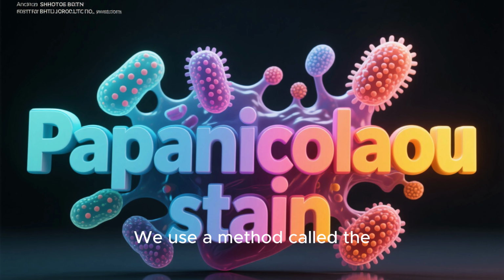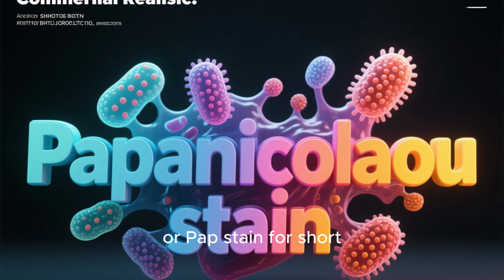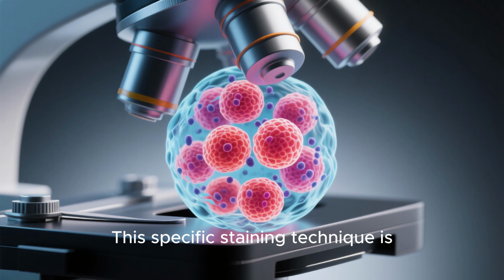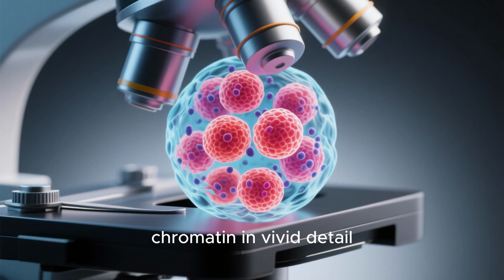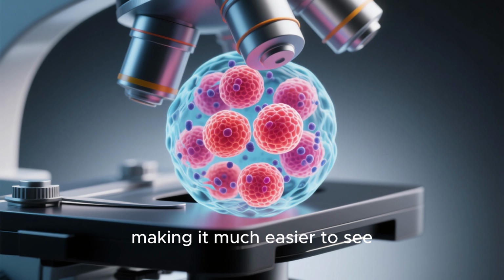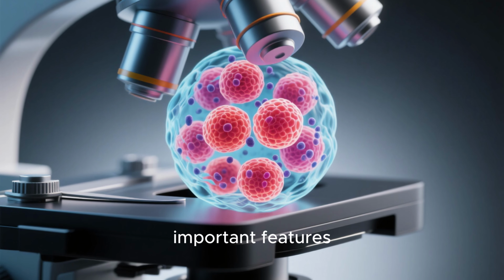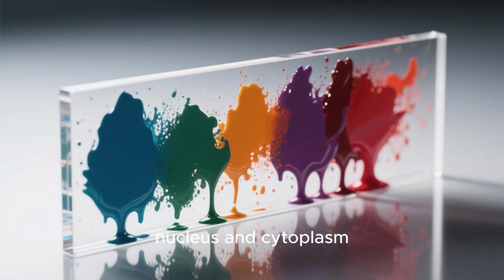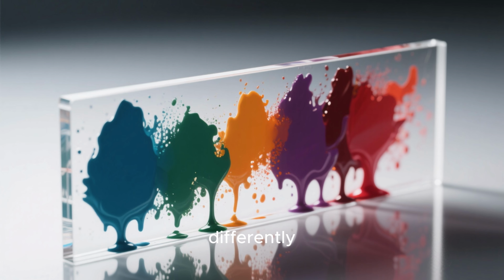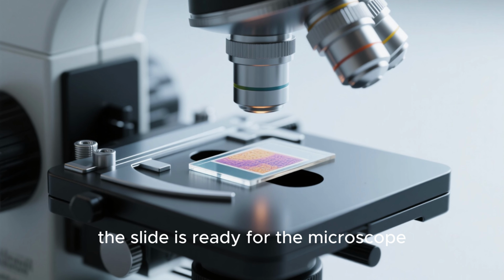We use a method called the Papanicolaou stain, or PAP stain for short. This specific staining technique is fantastic because it highlights the cell's nucleus and its chromatin in vivid detail, making it much easier to see important features. The process involves a series of dyes and rinses that color the nucleus and cytoplasm differently. After staining, the slide is ready for the microscope.